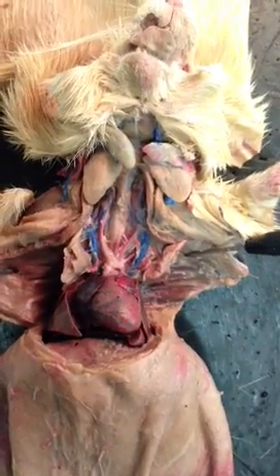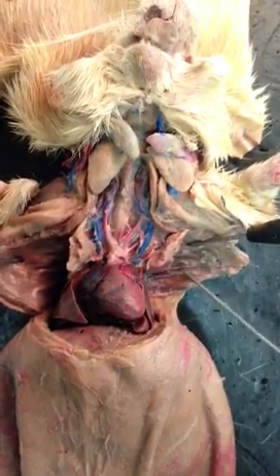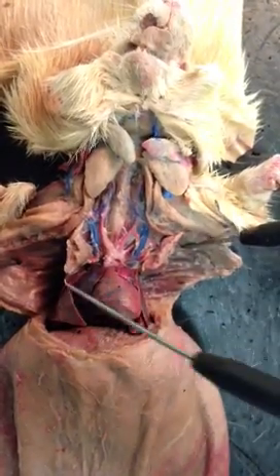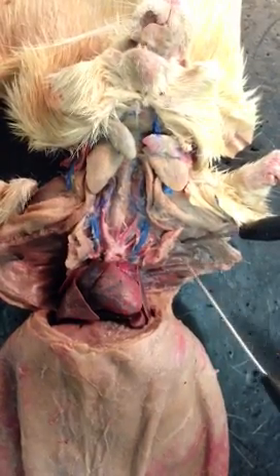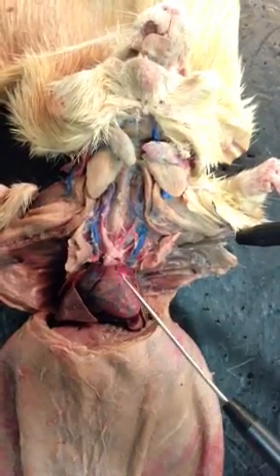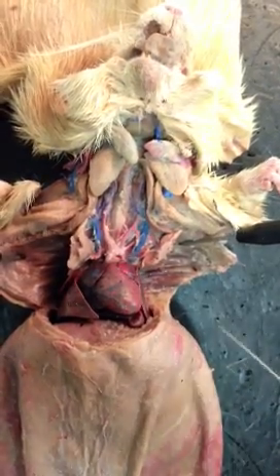Okay, so parietal pleura. Parietal pleura is the outside. We already got rid of it, but it is also this right here that you can kind of see, it's shiny. Okay, visceral pleura. Visceral is actually on the lungs. So parietal pericardium, parietal is just the same thing too, on the outside of the heart. Right, the parietal. And then the visceral pericardium, right here.